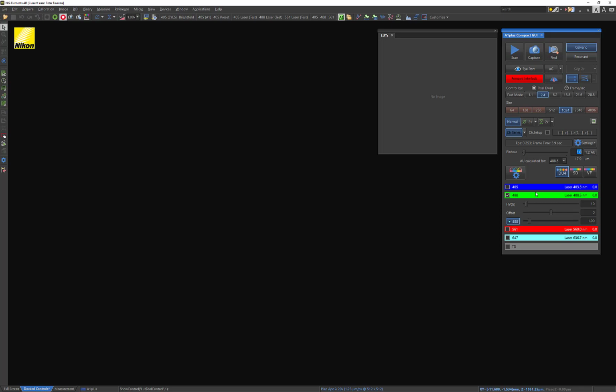So those are overall the settings that you'll want to use to adjust the signal that you actually acquire in your image. So let's go ahead and find the best settings for one channel that I have already selected here, the 488 green channel. And let's find the best settings for a particular sample I already have on the stage ready to go. So I'm going to start just by selecting what I think are the desired resolution and the dwell time, and whether or not I want to average any of my frames.